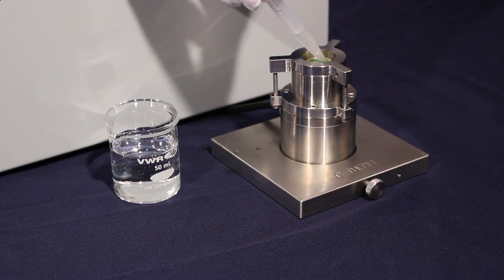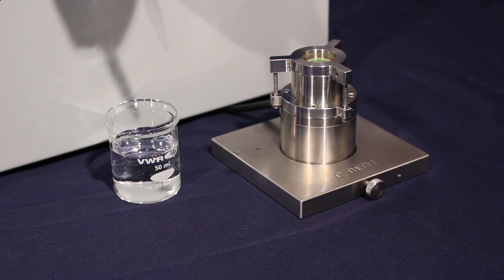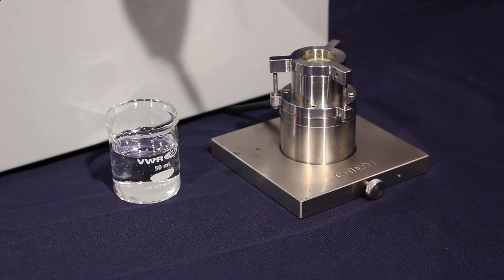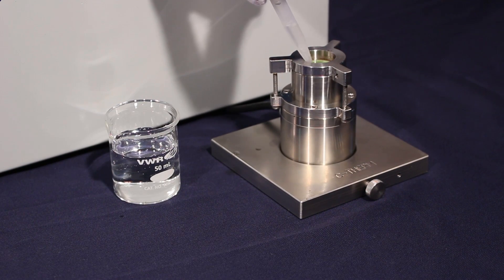Today we're specifically going to look at measuring water utilizing the small volume test kit, but before we move to that I want to talk a little bit about the principle behind the system.